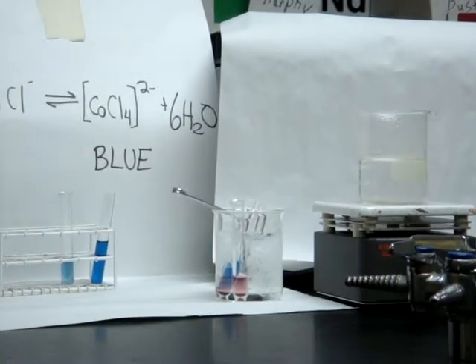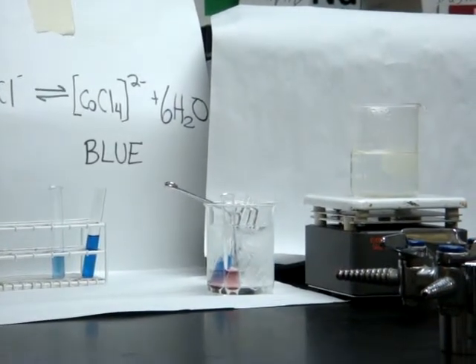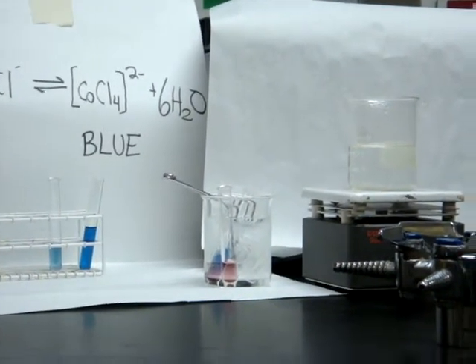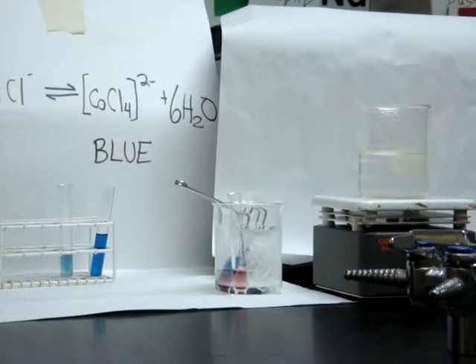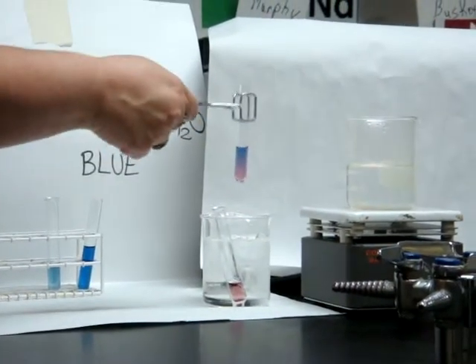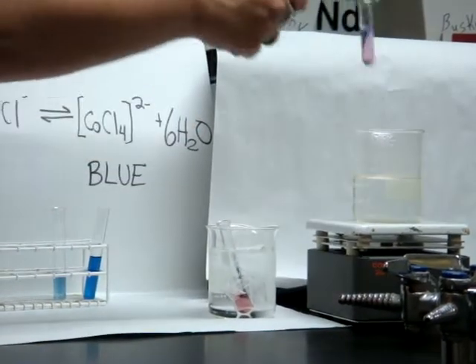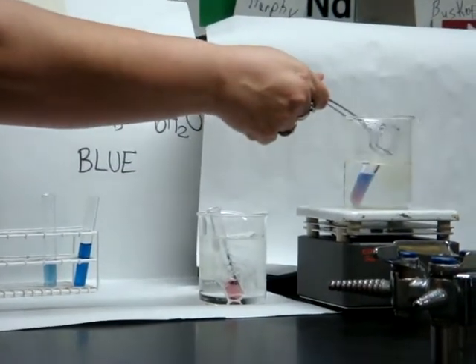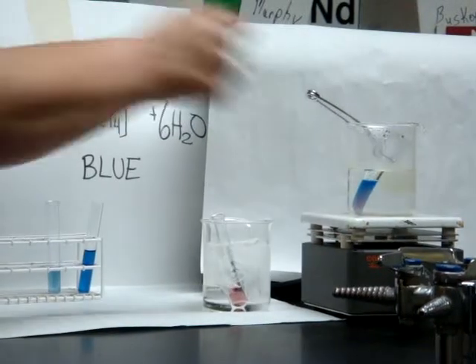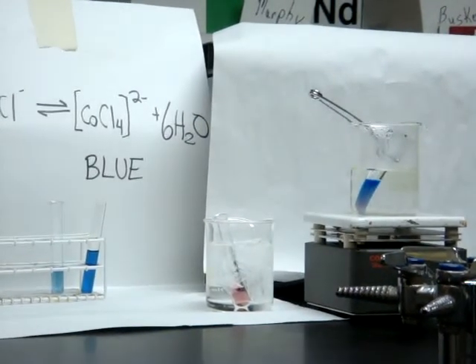Now, this is the cool thing about an equilibrium reaction. I can shift it back and forth, back and forth, as long as I have patience to keep putting it in hot and cold water. There. It's turning almost all pink now. But I can put it back in the hot water. And it will shift back to being blue. Yeah, really quick.